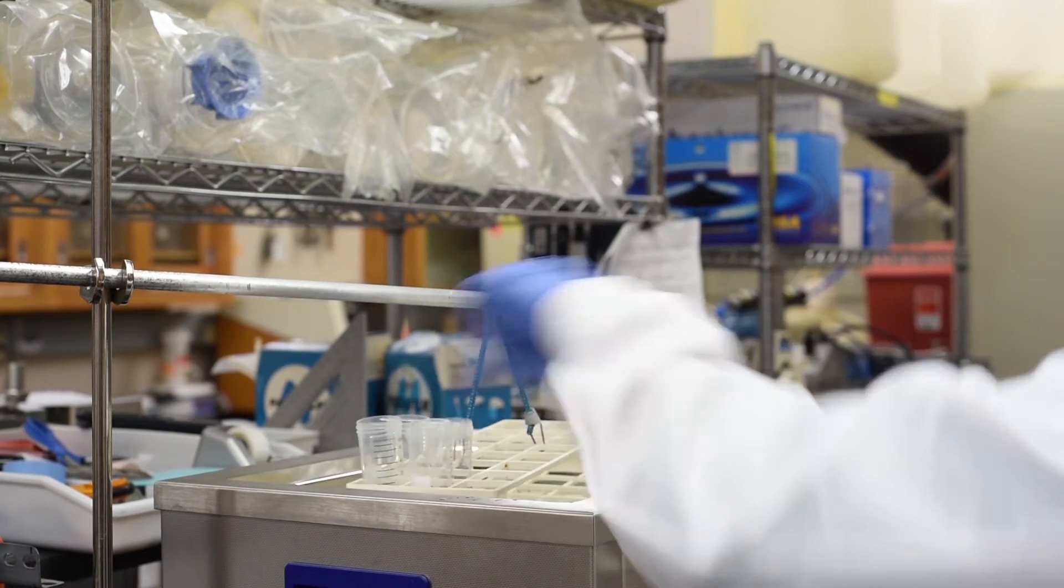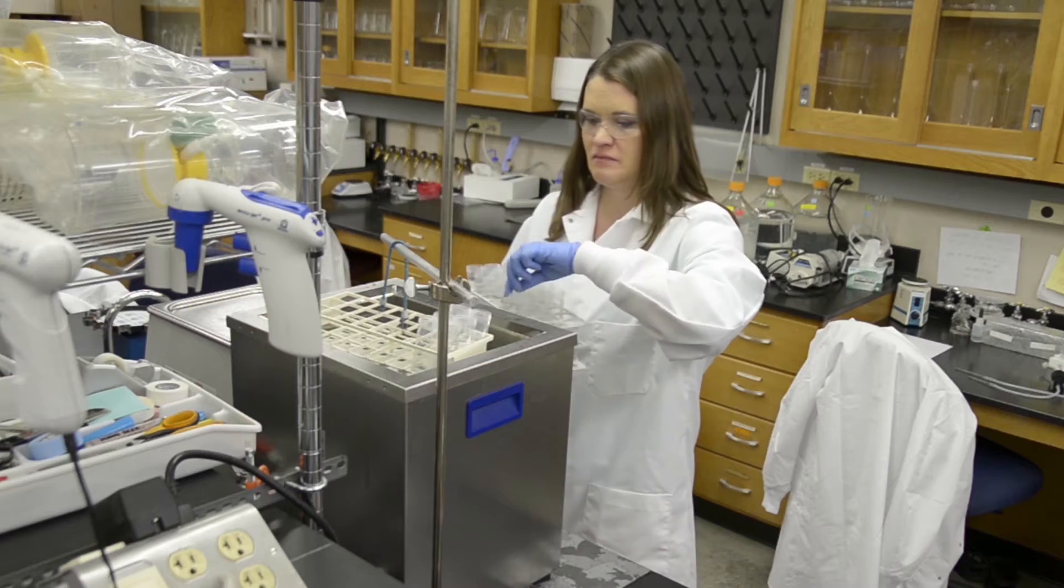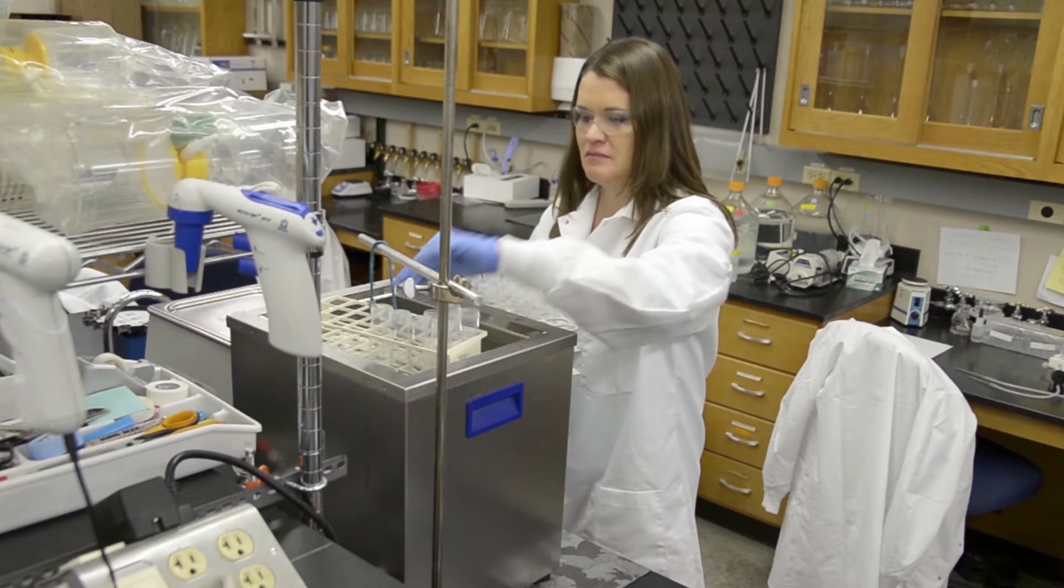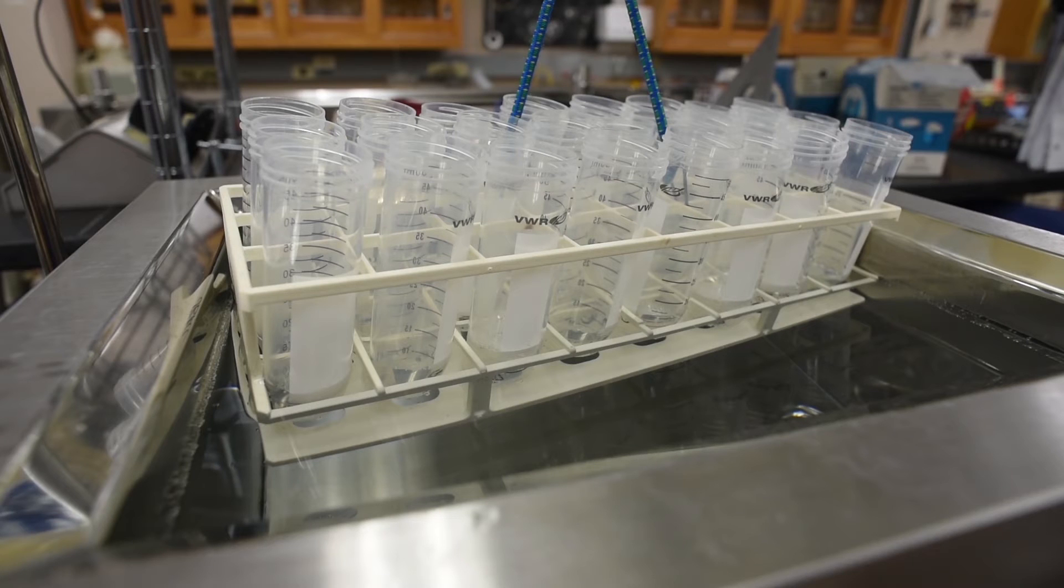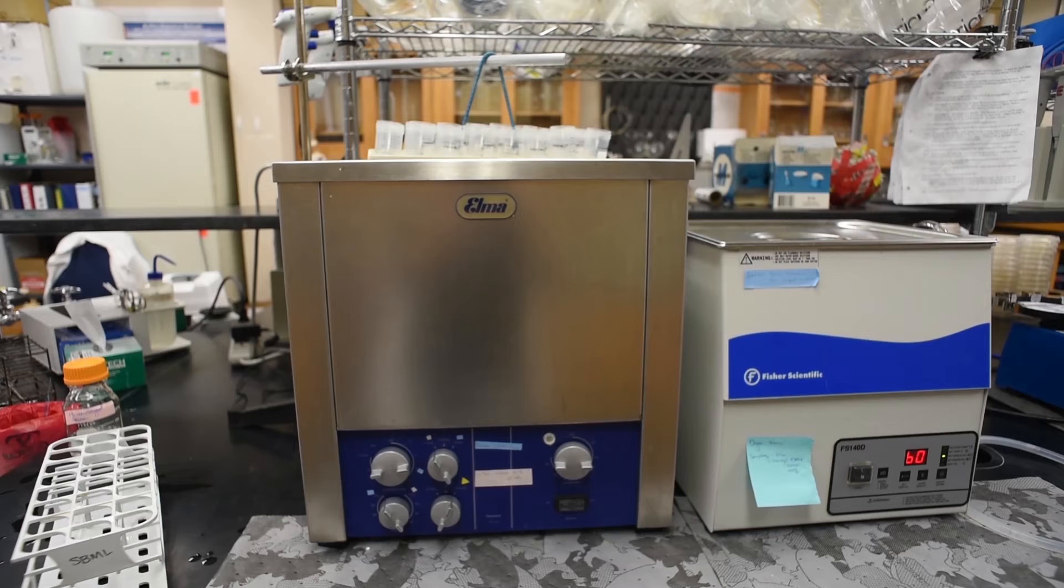Transfer the vials to a rack in a degassed sonicator bath. Ensure the liquid level in the vials are even with the liquid level in the bath. Sonicate the coupons for 5 minutes.